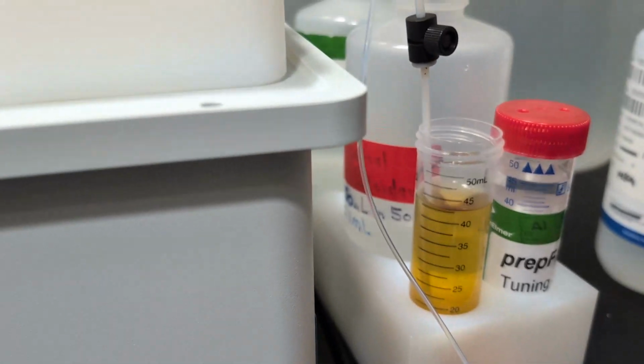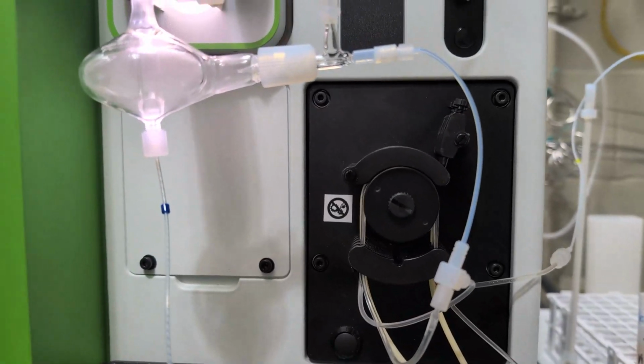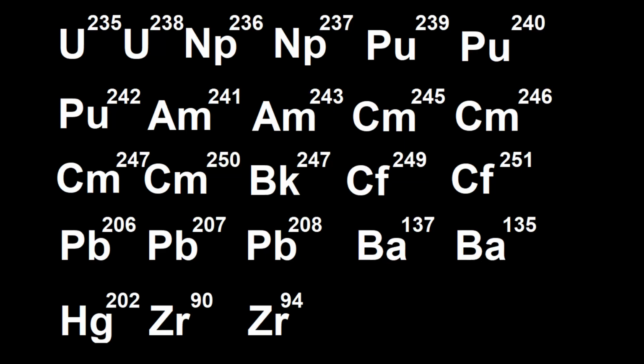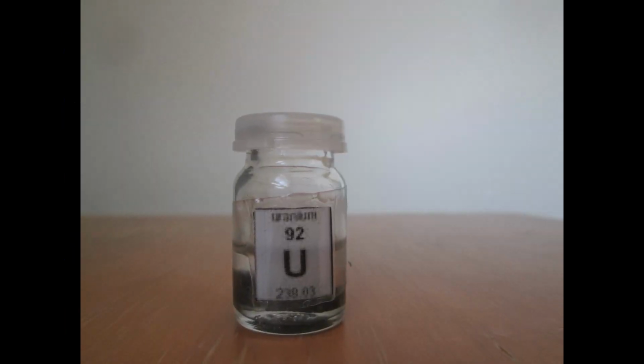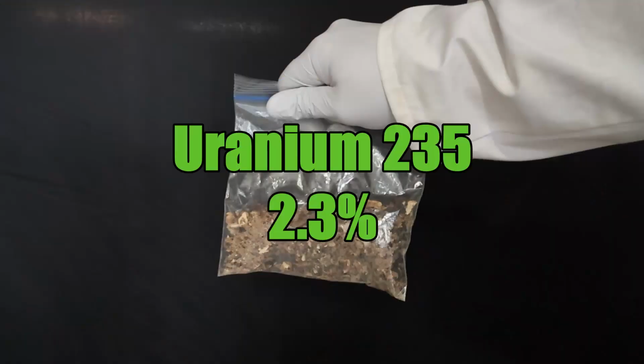To determine if any actinides are present, I use a triple quad ICP-MS, not unlike this one. I used a 1:10 dilution and a dwell time of 1000 milliseconds for all these isotopes. Despite using clean glassware, uranium was found in both samples: natural uranium concentration for the store-bought mushrooms at 0.68% uranium-235, but 2.3% for Chernobyl ones. Because RBMK reactor uses 2% enriched uranium, some uranium must have been carried to the woods of Russia and deposited in the soil where the mushrooms are growing today.